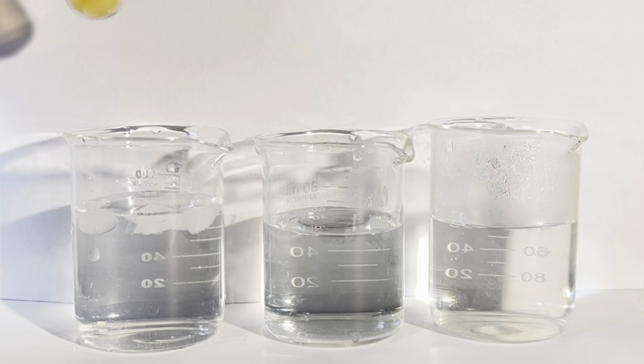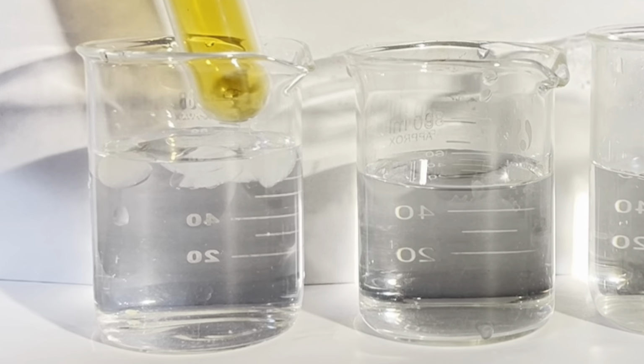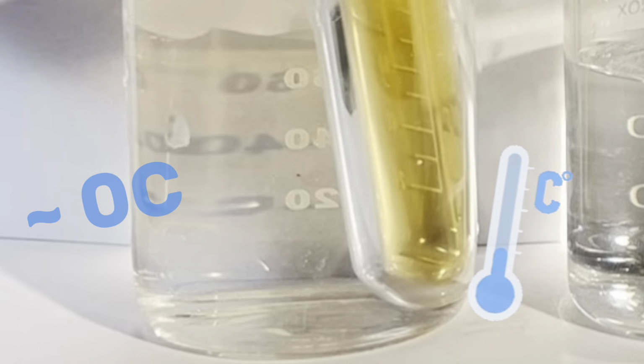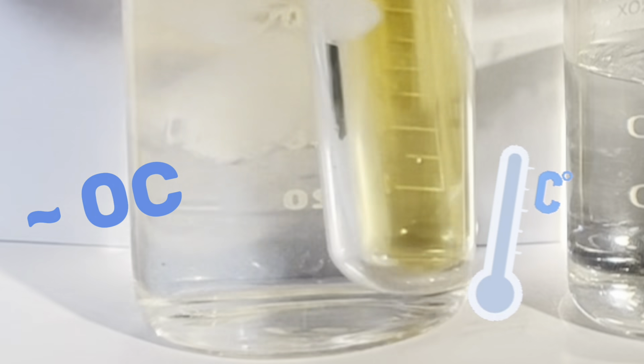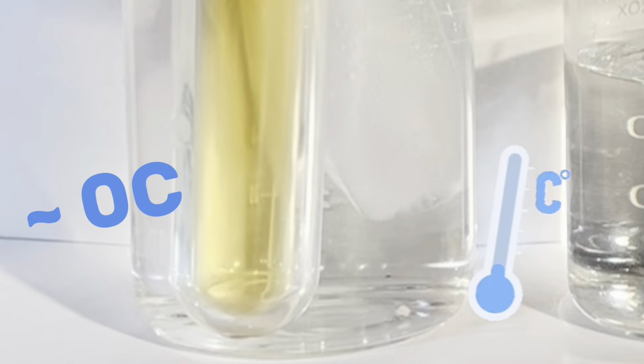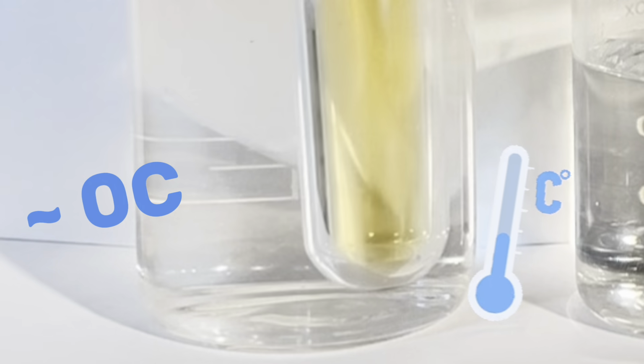So what we'll do next is subject the equilibrium system inside the ampule to a range of some more reasonable temperatures and watch how it shifts. The first beaker is full of ice at about 0 degrees Celsius, and we're going to see the color of the gas in the ampule lighten slightly. It's a bit subtle, but it's noticeable.